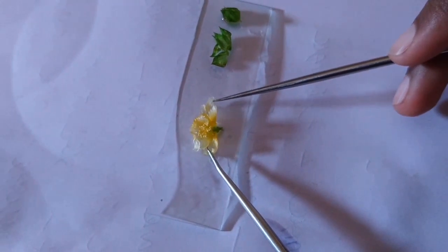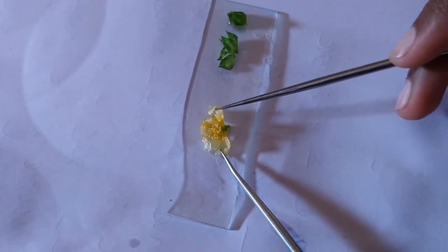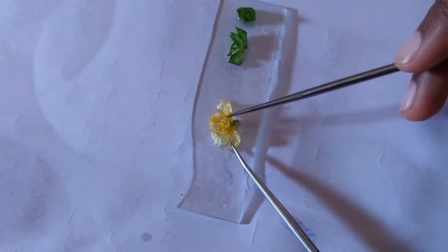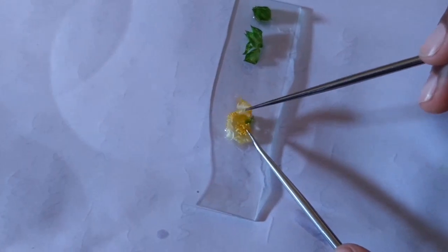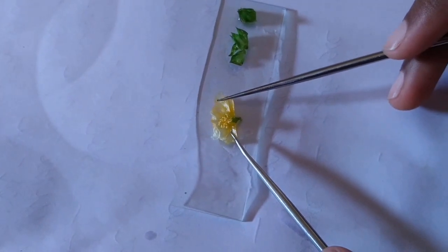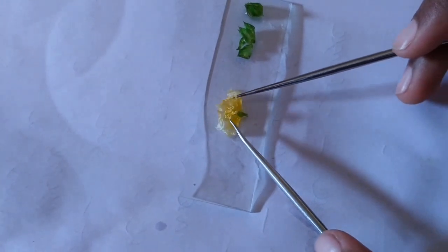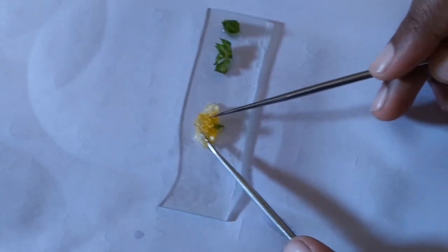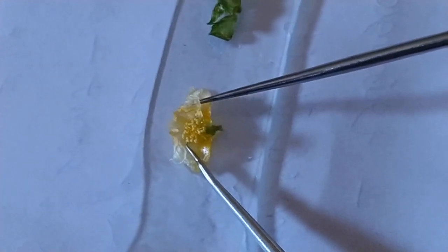That is the corolla, or petals of Sida. The arrangement or aestivation type of petals is twisted. The corolla is also 5 in number. That is the stamens, or the gynoecium and androecium of Sida.